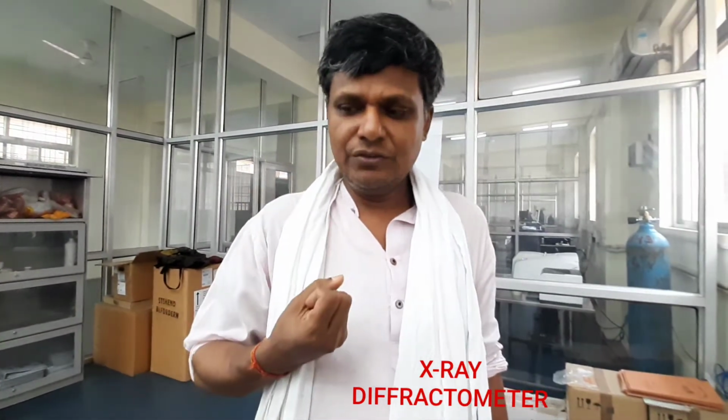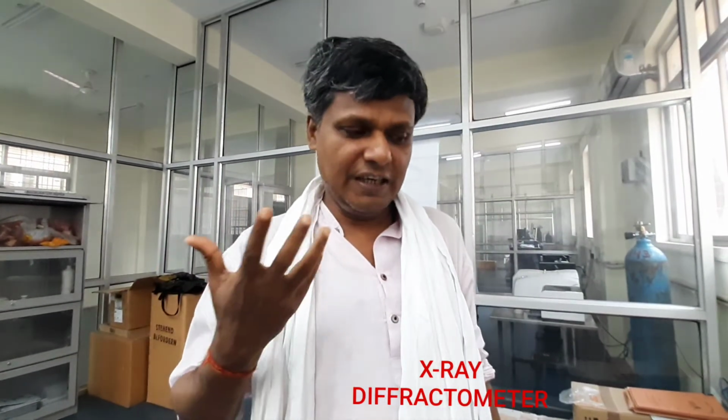And what is the importance of this? We know that the properties of any material depend upon the purity of its phase and its crystalline structure. Therefore, if you determine these, you can obtain the crystalline structure and interplanar distance. Such physical properties can be used for various device development in science and technology, such as in electronics, in recording media, in iron oxide based industries, in nanomedicines, agriculture, and so on.